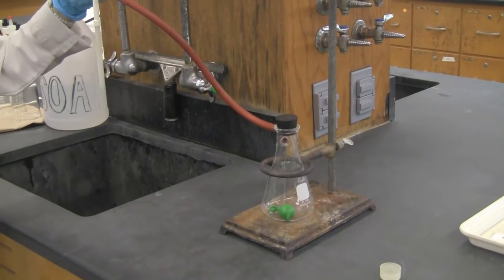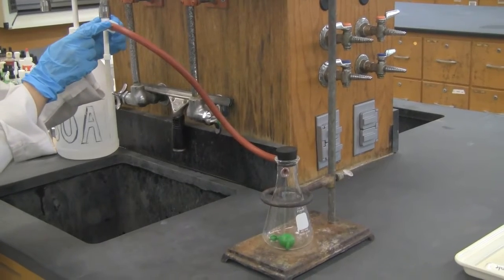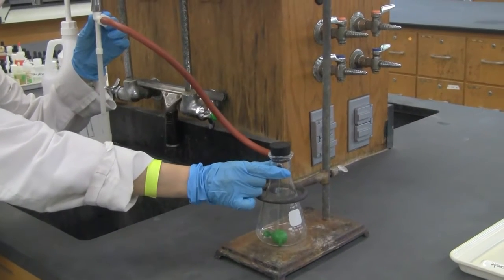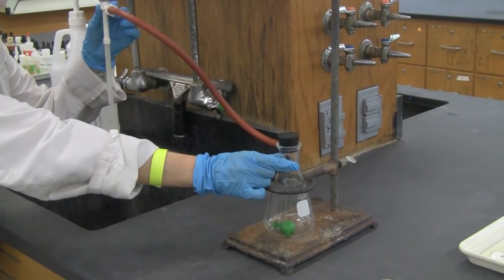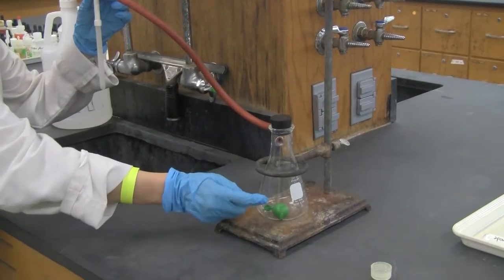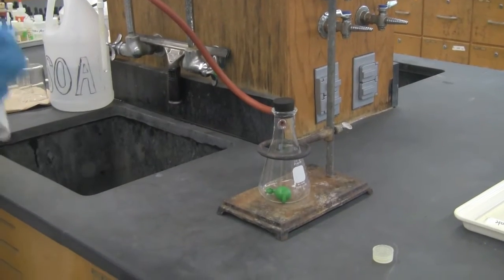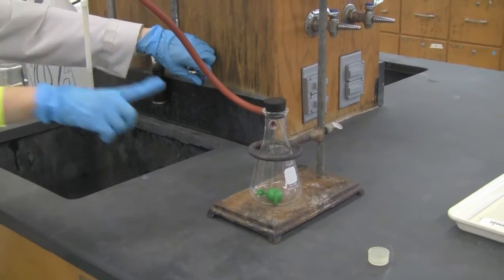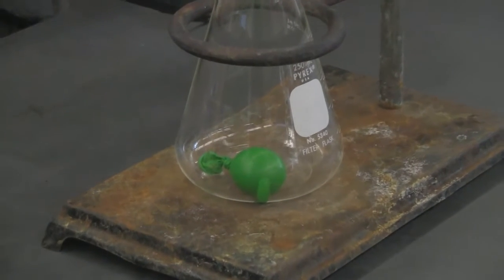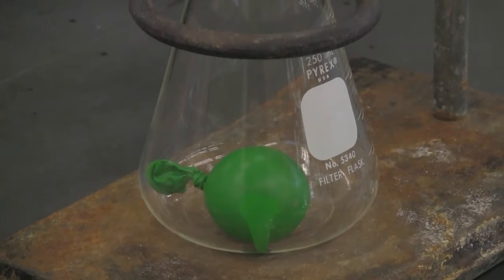When I turn on the water, water will flow down. When water flows down, it will draw the air out of the sidearm flask. So the air is drawn out of this container. What does that mean? Fewer air molecules, less collision of the air molecules on the wall and on the balloon. So the pressure will decrease. Okay, then you will see what happened to the balloon. Now watch the balloon closely. What is that? The size changes.